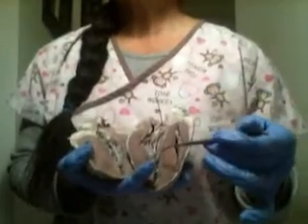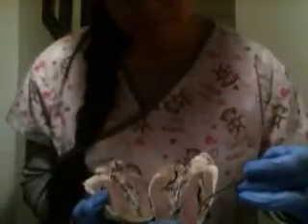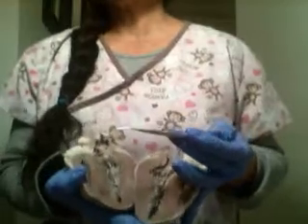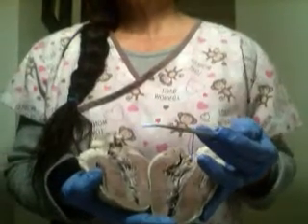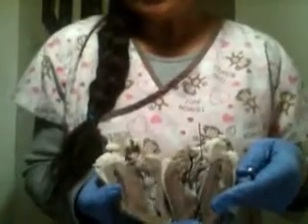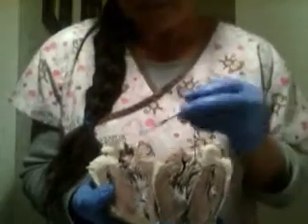And chordae tendineae is a little muscular area. Maybe it's around here, right here, and here. And let me see, cusp of the valve. I cut it wrong, so it's kind of hard to see, but it's 3 leaflets, like on the pulmonary semilunar valve on the top. I just cut it, so it's very hard to see.